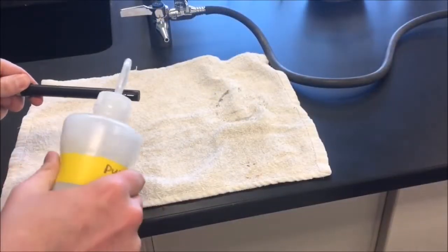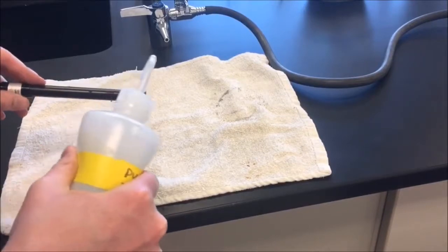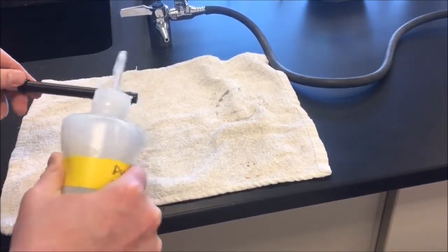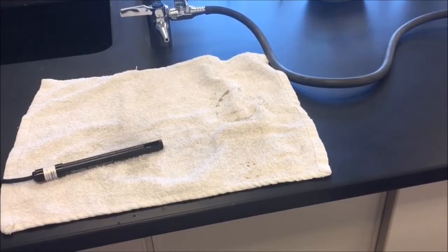One more time, let's spray some distilled water on our conductivity probe. And let that dry off a little bit before the lab is done.